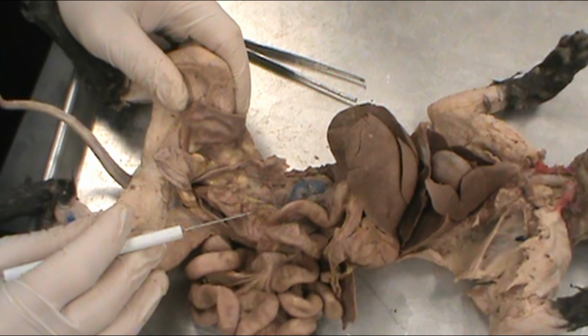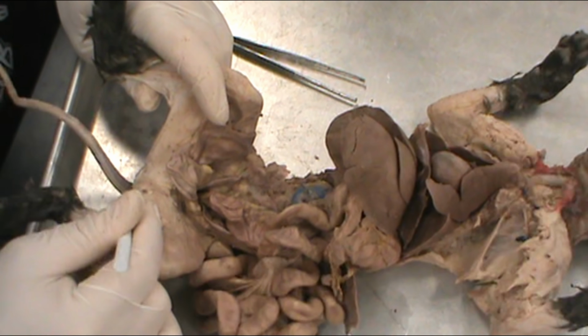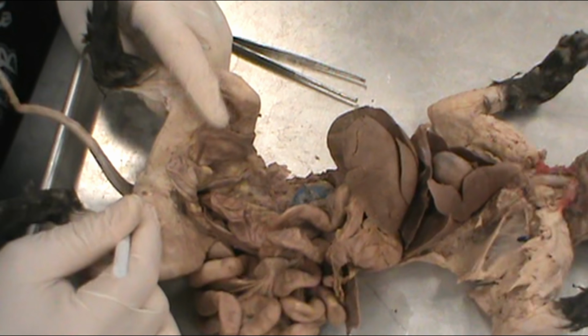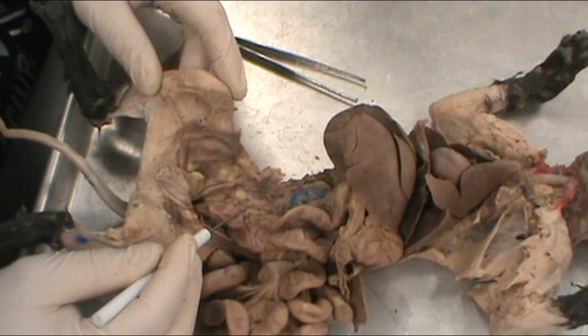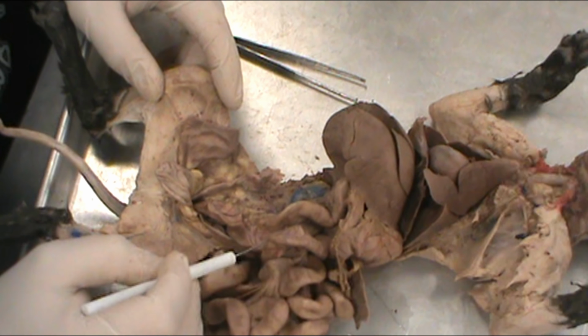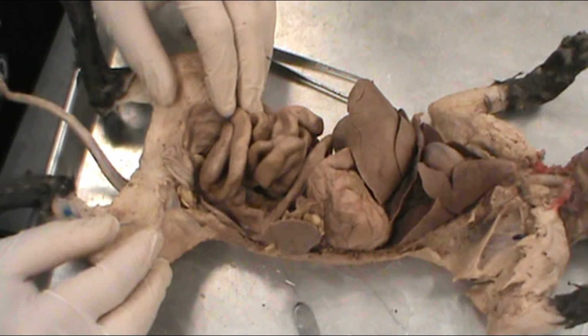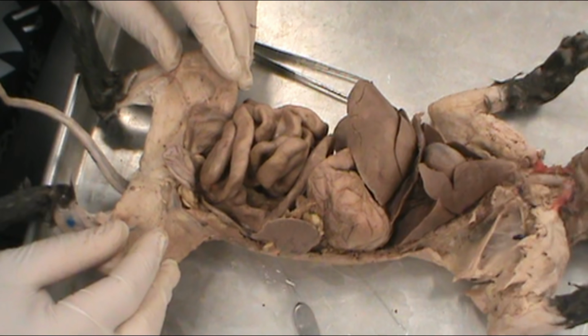All right. The other dead giveaway would be the two openings at the back of the body there underneath the tail. Males only have the one visible opening. All right. So hopefully that will give you all that you need to walk you through studying for your cat organ practical. All right, that should about do it for the overview of the cat organ lab practical.